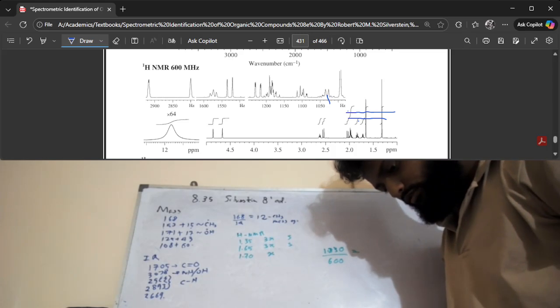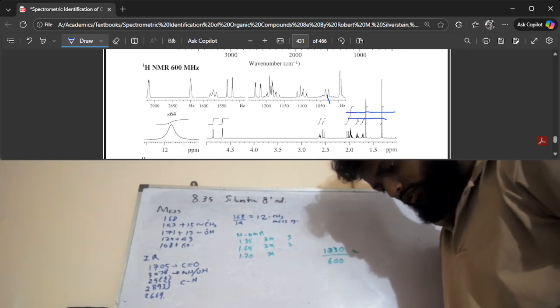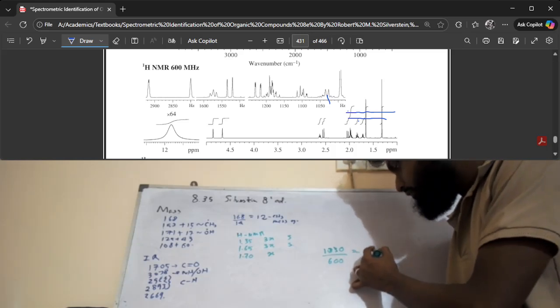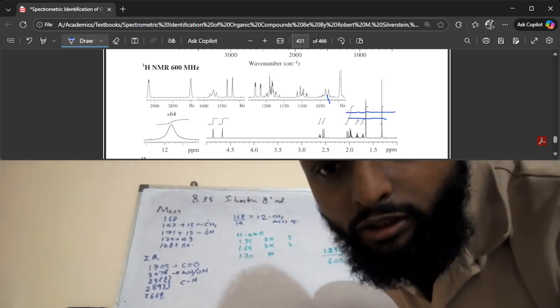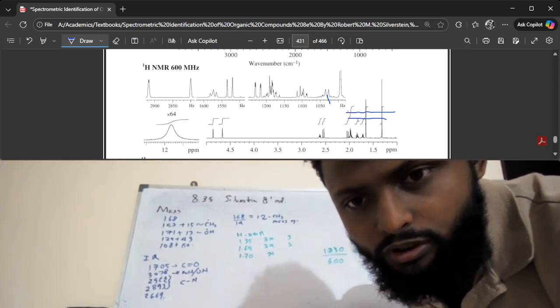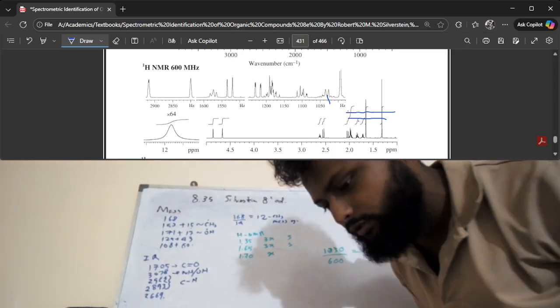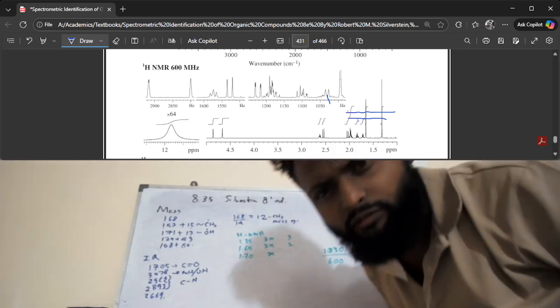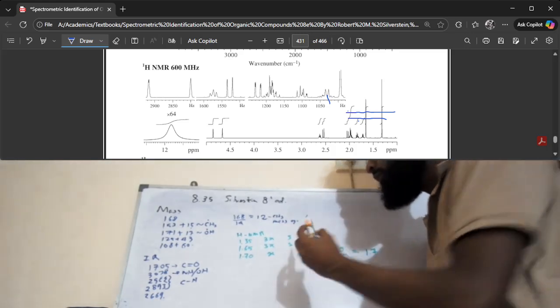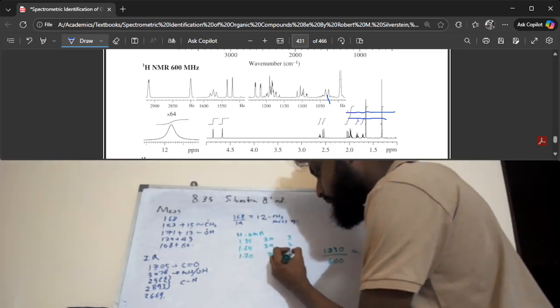1030 divided by 600 is 1.7. So this particular vertical line that I drew corresponds to the 1.7 peak. So it's a doublet, right? It's clearly a doublet. So we just put the doublet over there.